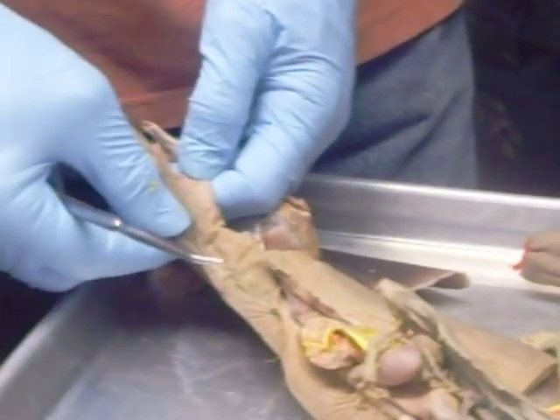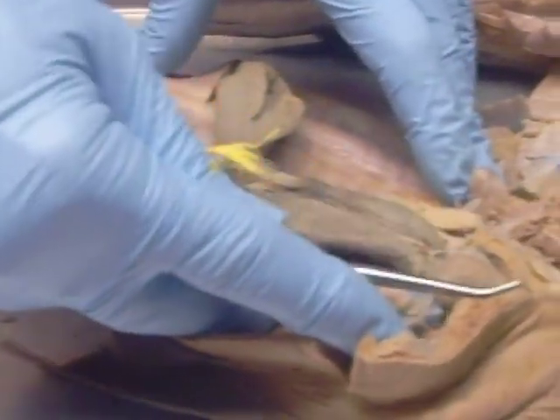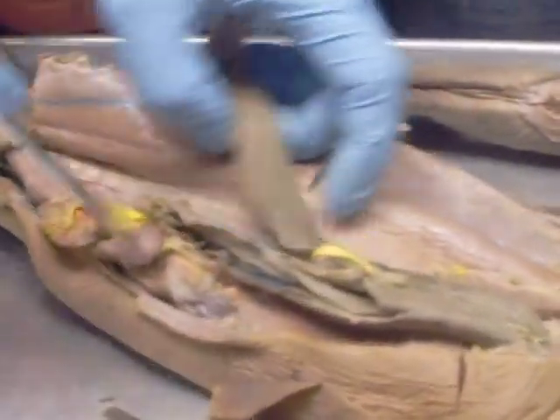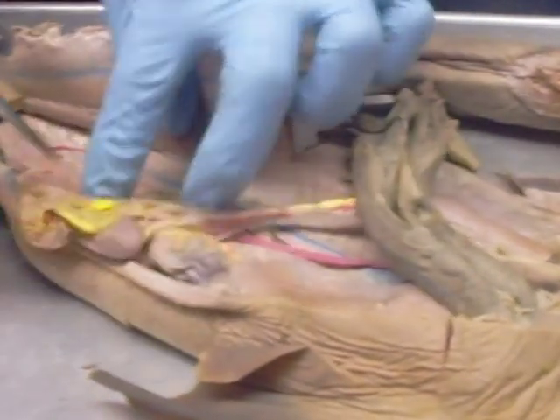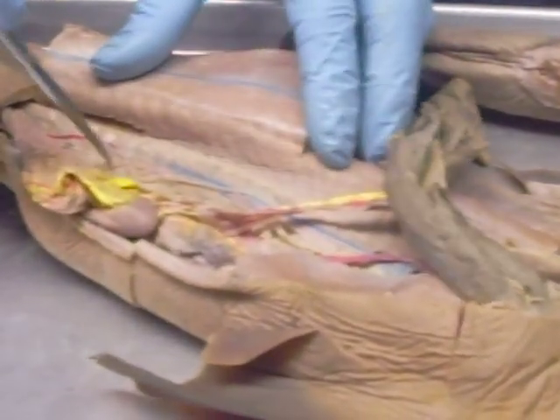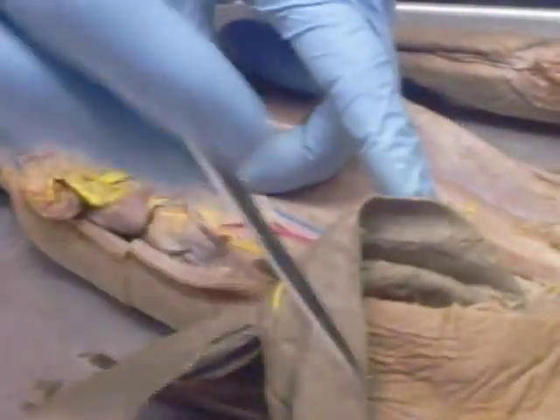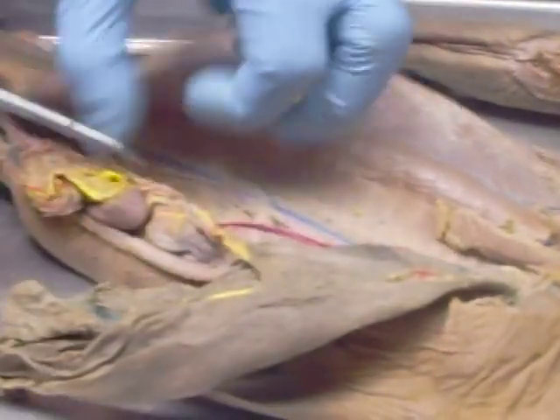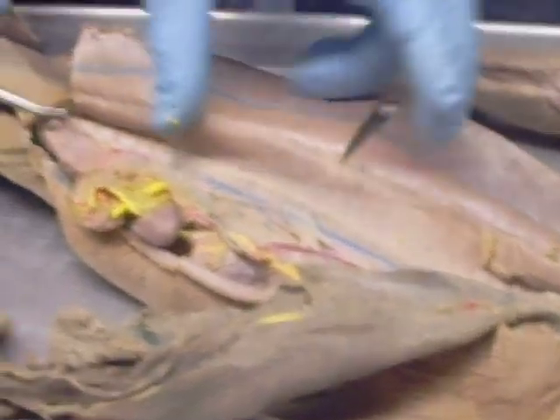The fin is going to finish up just like that. But what I'm anticipating is that I'll pin out three or four things from this — they're going to be obvious. Probably at least one blood vessel; I usually pick either the celiac or these back here that cross if they're big enough. The liver — I've got to put some easy questions on there — the gallbladder, the stomach, the spleen, the pancreas. Those are the main things.